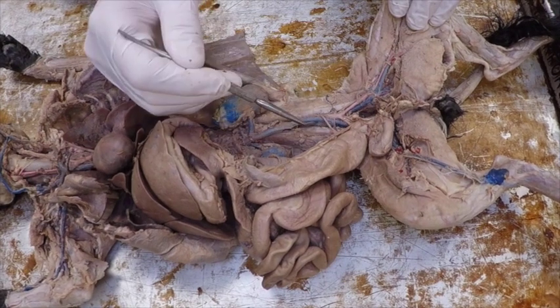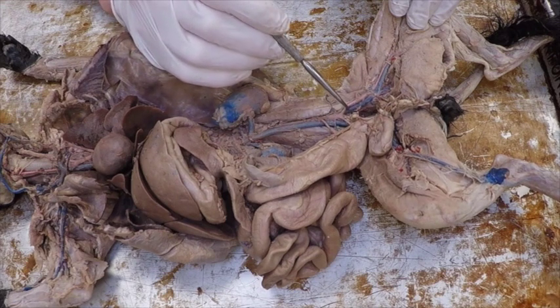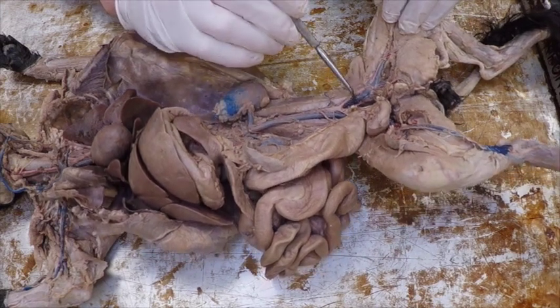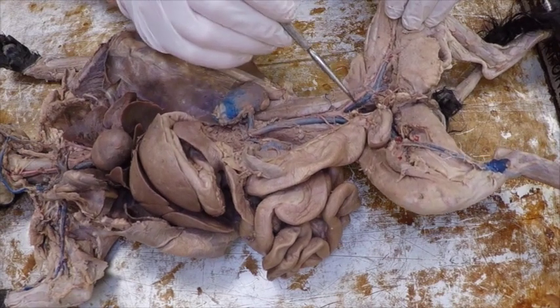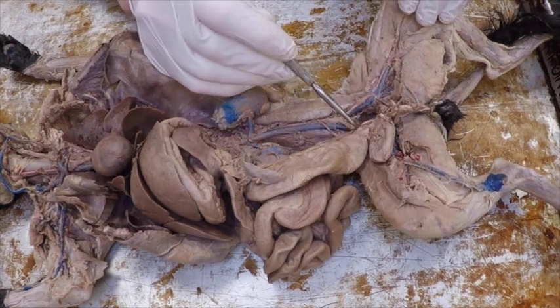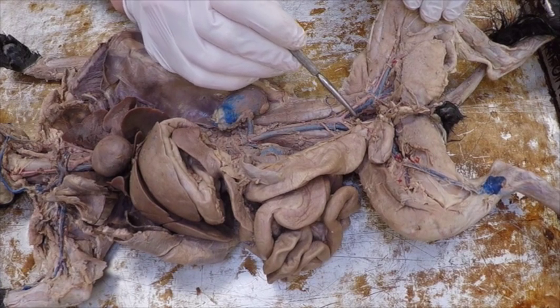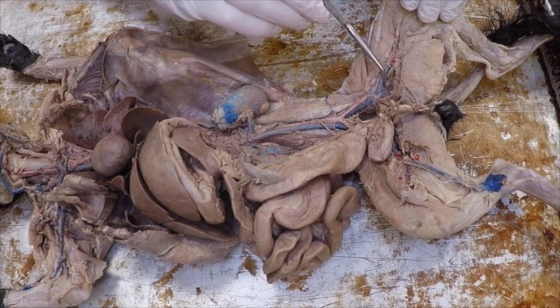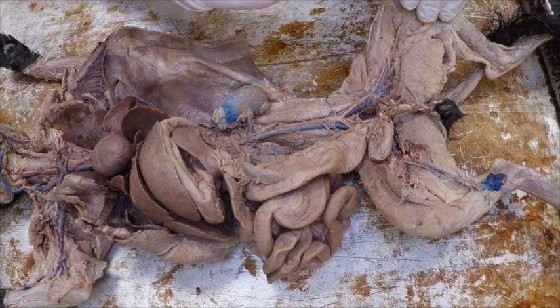Once this inferior vena cava splits, then it becomes the common iliac going towards each leg. The common iliac ends as soon as I get to another split, and there is an internal iliac going down right there, going deep, and then it becomes the internal iliac going deeper and the external iliac that keeps going. In between, way in the middle here, there is a caudal vein and a caudal artery that go towards the tail. Now I'm going to go back to the external iliac here, the vein, and when it splits again here, I've got the deep femoral vein, and I've got the femoral vein going towards and along the femur.